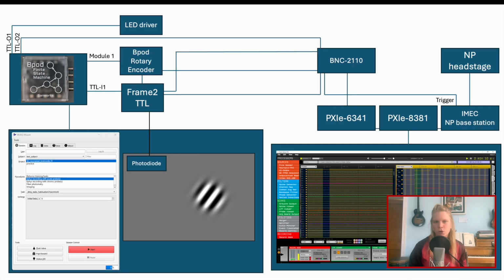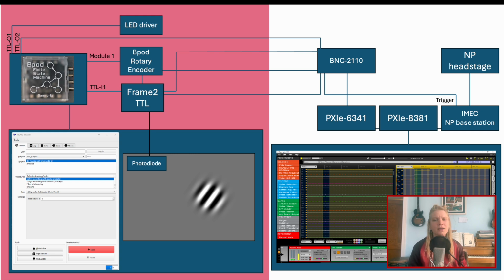My setup's pretty much according to the IBL's appendices. I have two computers, one installed with the IBLRig wizard and Bonsai and affiliated packages, thus serving the coordinated production of visual stimuli and drive to my opsin. The other mainly serving the Neuropixels device monitored with Open Ephys, which will receive inputs from the IBL computer to coordinate. So most of this presentation will focus on synchronization between the Bpod components, that's the left side of the screen, because IBLRig, Bonsai, and Bpod are a huge chunk of software. I'll show you how I approached their structure.